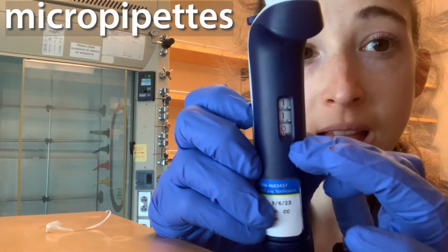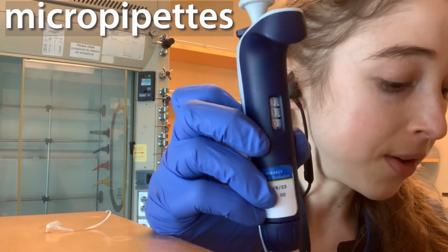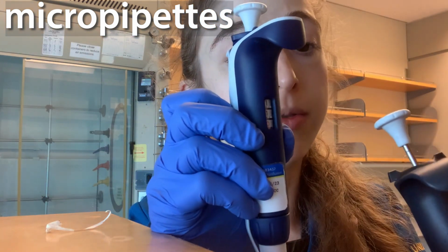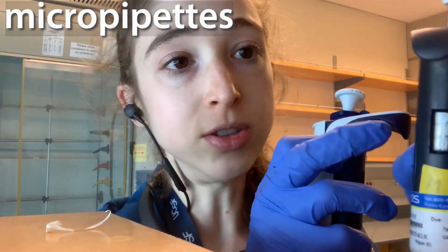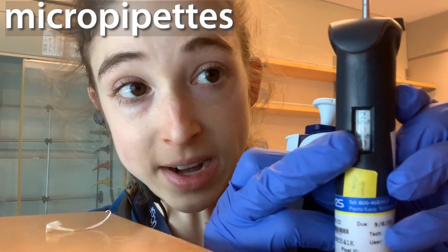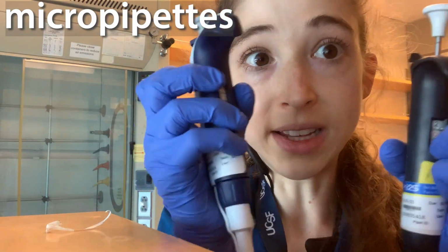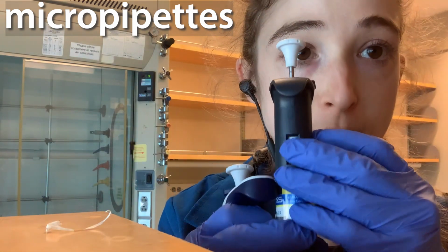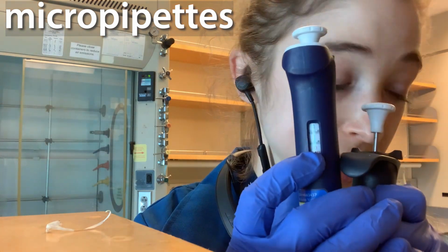Sometimes you'll see there'll be a line, and then what's under the line is going to be under the decimal point. If I look at a P2, it's here. I go from 0.1 to 2 microliters. And you can see here there's 2 red digits. So this is telling me I can get 2 more digits of precision with this pipette. Whereas with this one, I could go 1 after the decimal point.